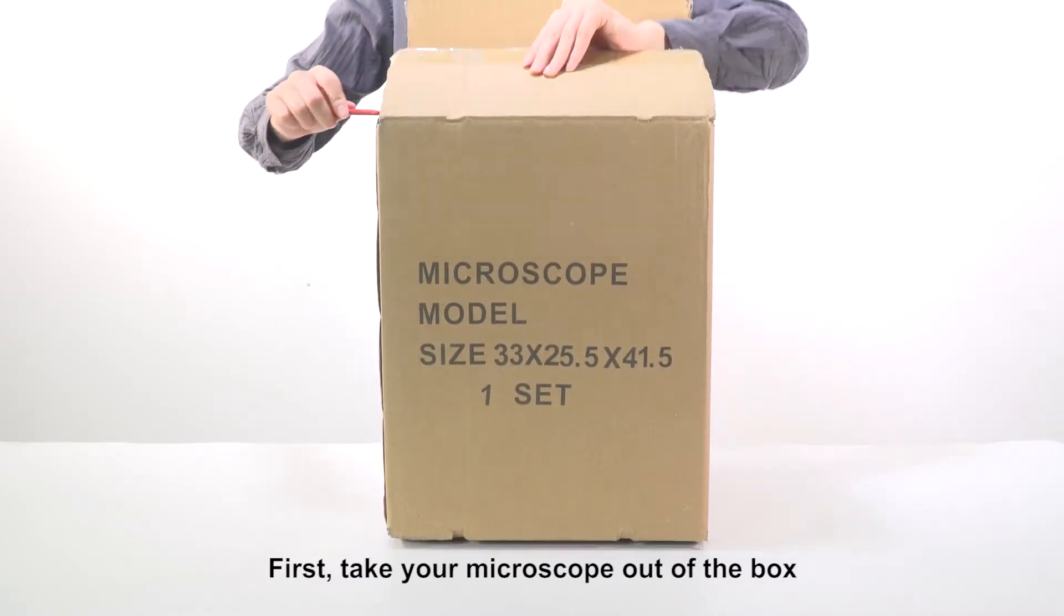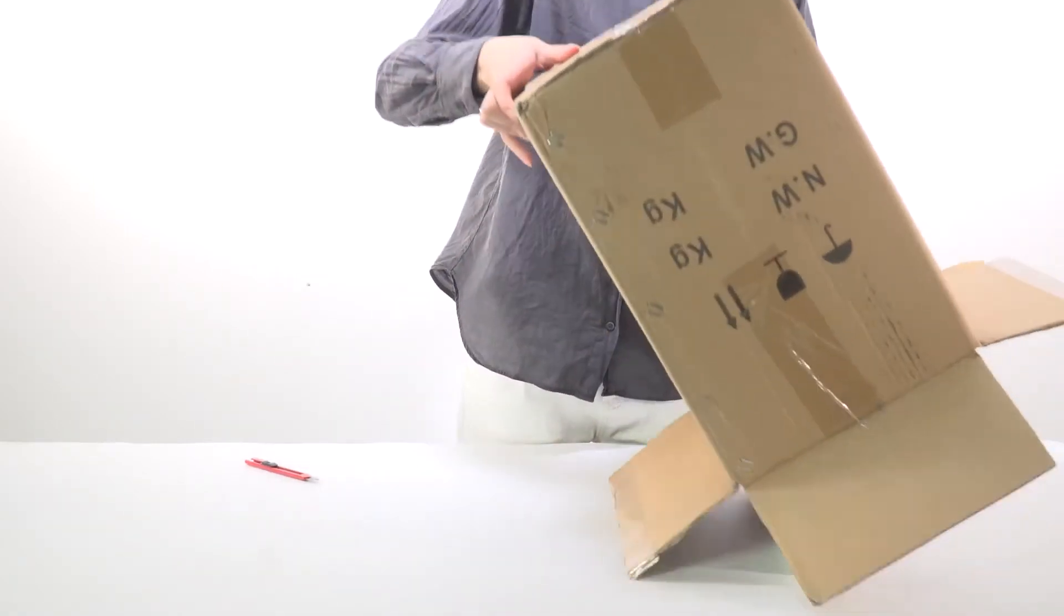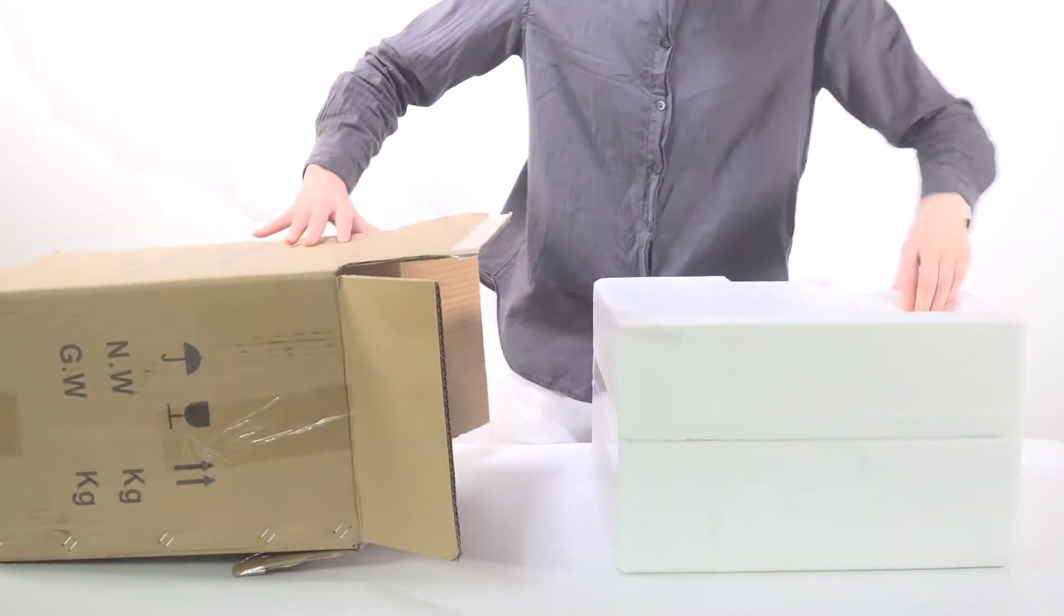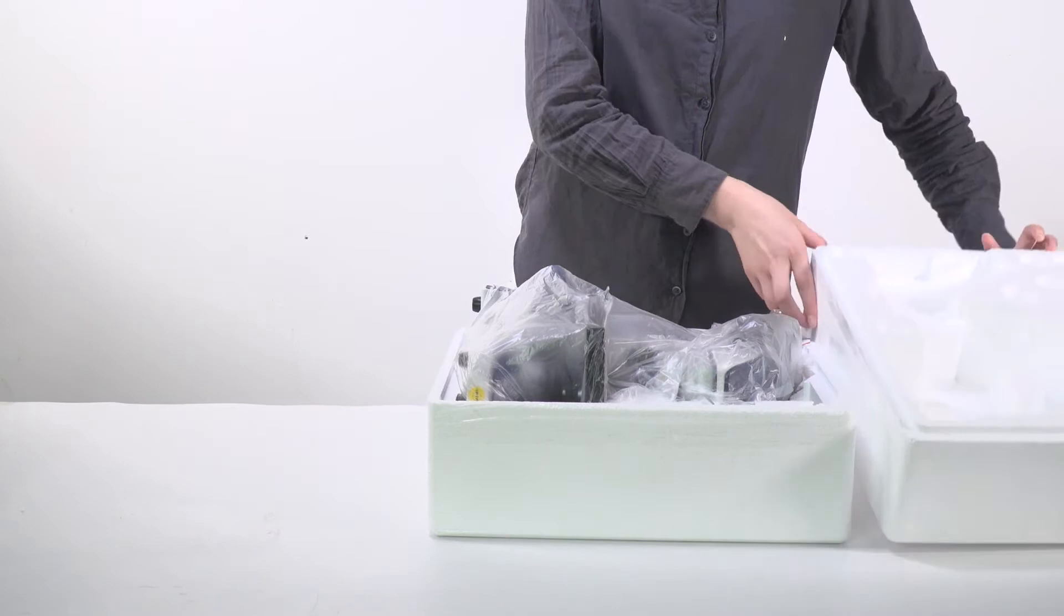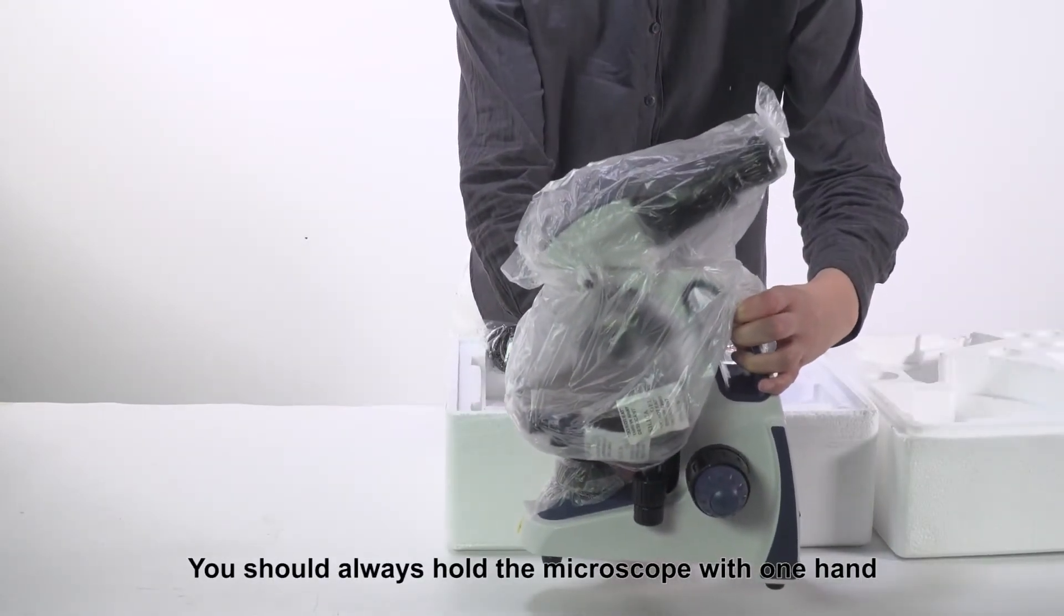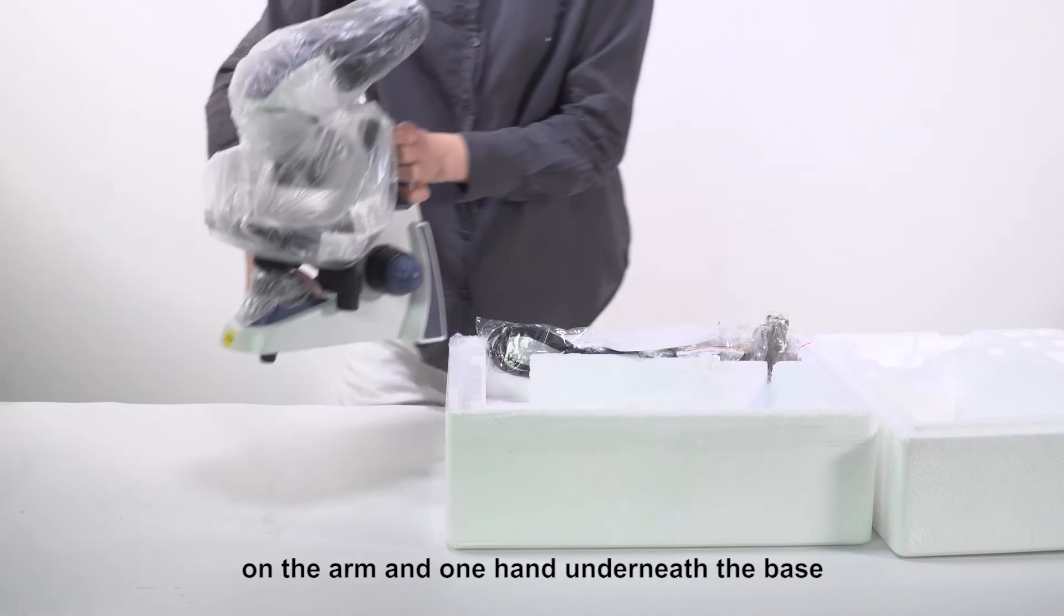First, take your microscope out of the box. You should always hold the microscope with one hand on the arm and one hand underneath the base.